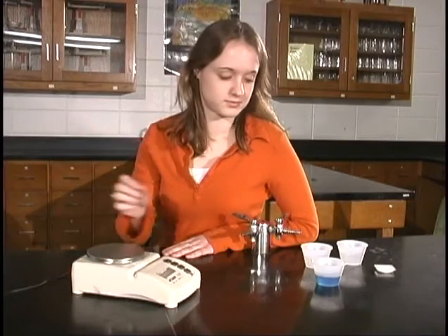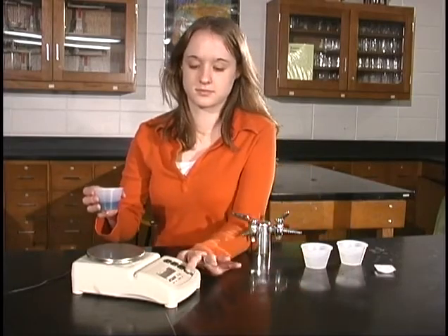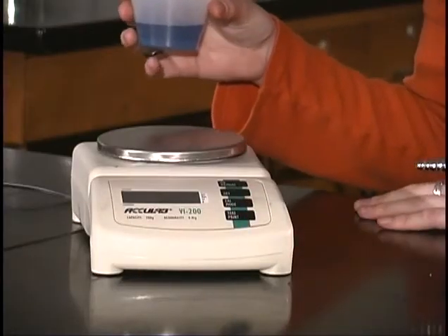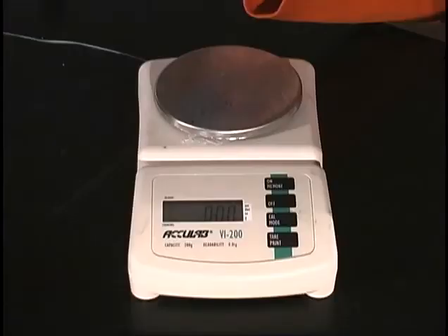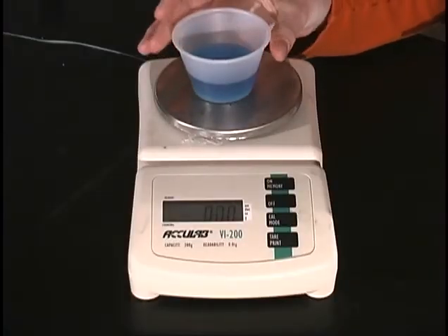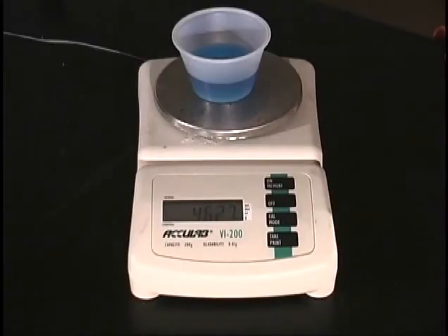Now, let's find the mass of this cup of water. We'll just push the tare button again to get the balance back to reading 0, and then we pour the water on the balance. No! What? Oh, you're right. We can't pour the water directly on the balance because it would spill all over the place. So, we're just going to measure it in the cup and assume it's close enough. No! So, you don't think that's a good idea either?